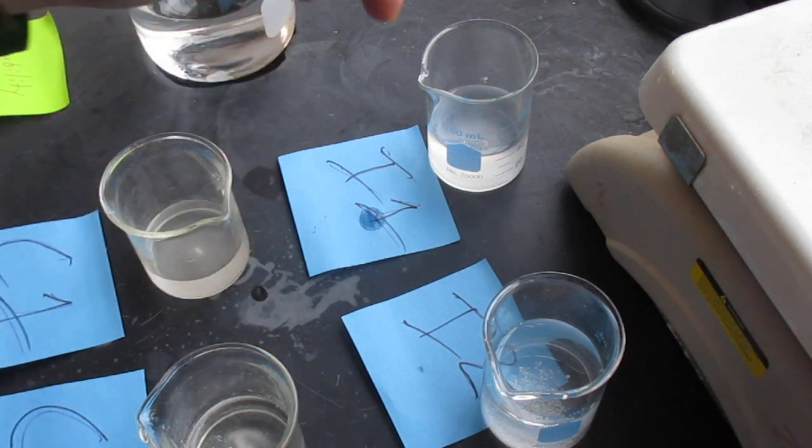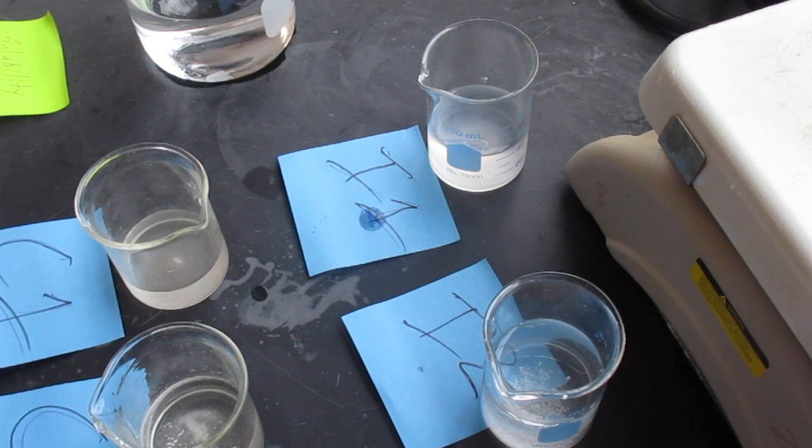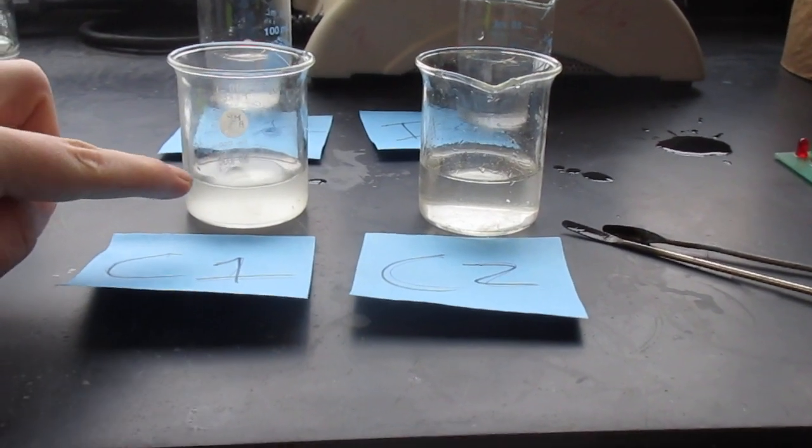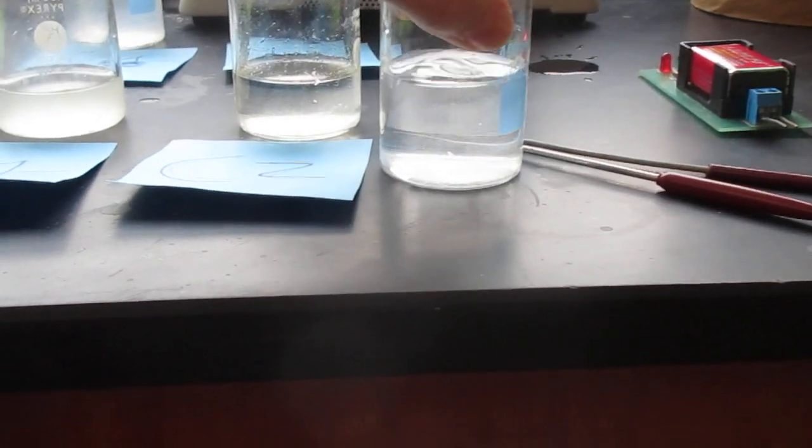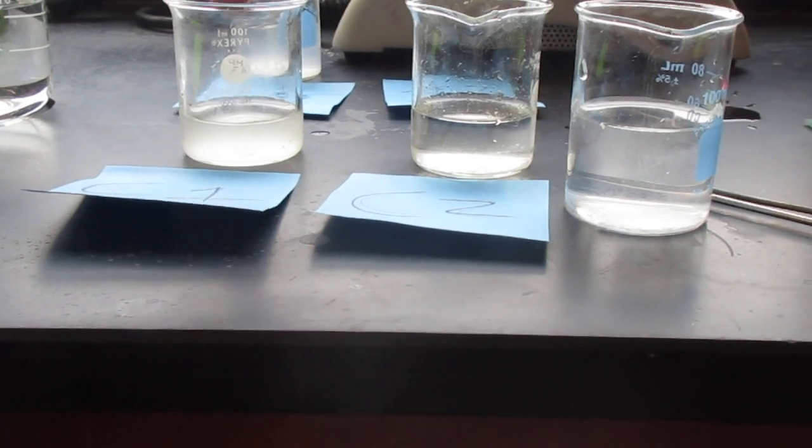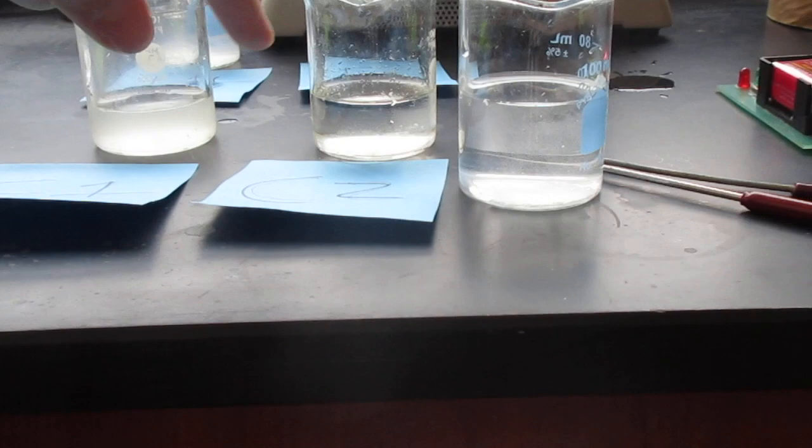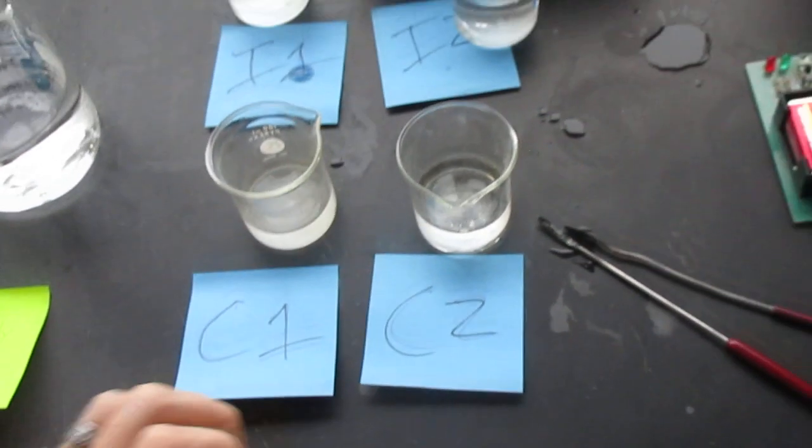So these definitely dissolved, these maybe a little but overall because of the difference, you can see how milky this one is when you compare it to this one. You can tell even with this bad lighting that this is not clear and this one's getting there. So these two didn't and the two ionics did.